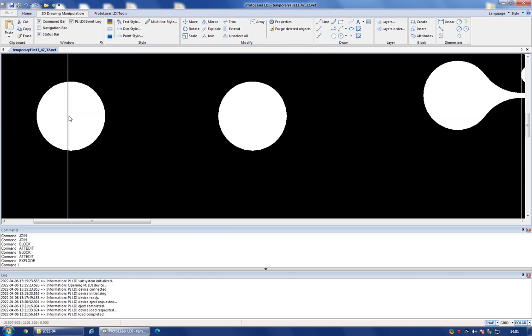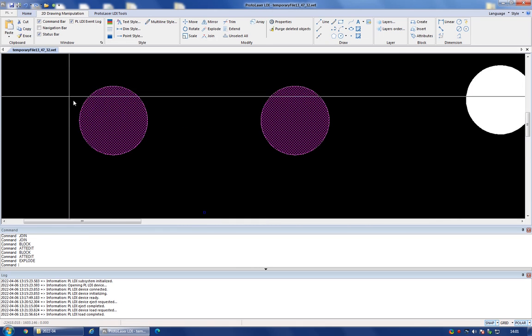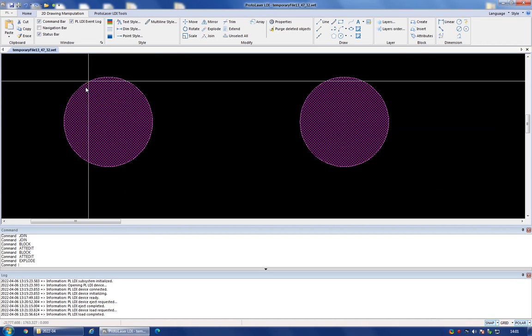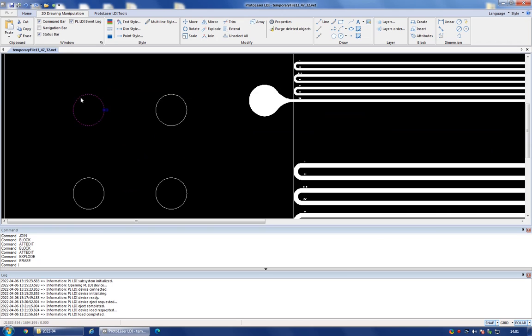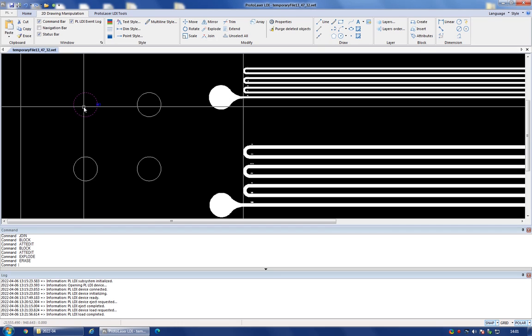itself. So now I can select the block. You see, I'm selecting all of these shapes, but you can see that there's also this white edge, which is actually the shape that has been used to create the block, and if I hit the delete button now, I have removed the filling and I'm left with the shape. So this is now back to the shape that I had in the beginning, and I can use this now and modify it and edit any position of any lines, and then when I'm ready I can recreate a block as I did it before.